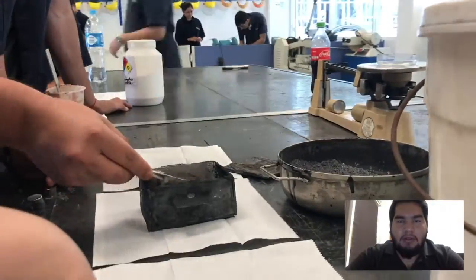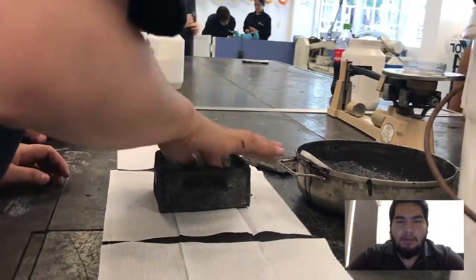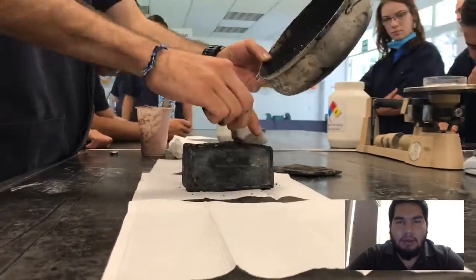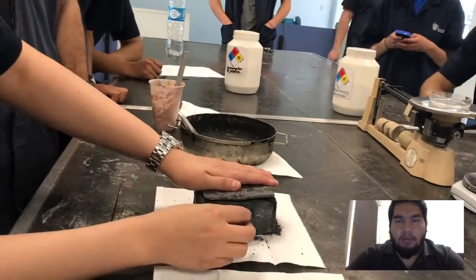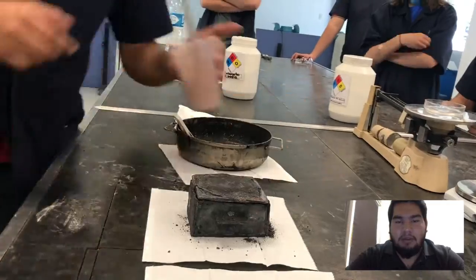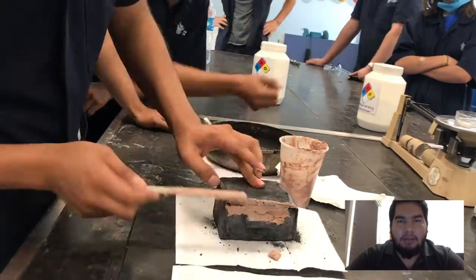After the mixture of substances was made, a lower bed of cementitious material was placed on the base of the box. The samples were deposited, leaving enough space between each other, and covered completely with the mixture that was made. Once the pieces and the filling were accommodated, the lid of the box was sealed with clay.